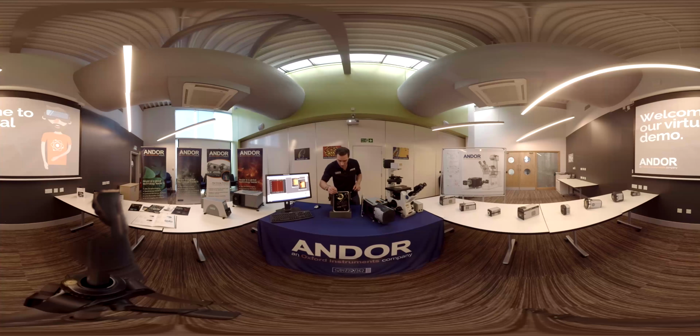The dispersed light then goes to the focus mirror. This is patent applied for. It is motorized, moving back and forward on rails, and that has a few advantages. So first of all, it allowed me to make the system much smaller because there was no need for a bulky flange for adjustment at the camera.